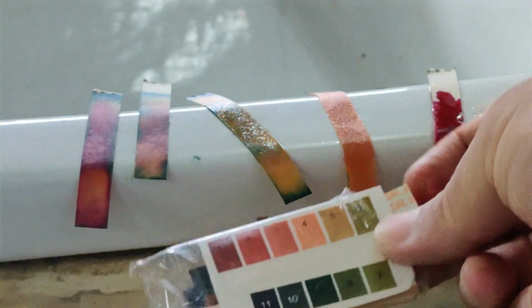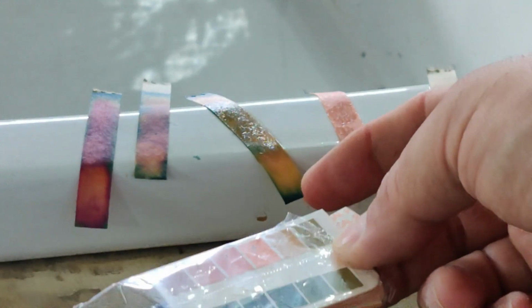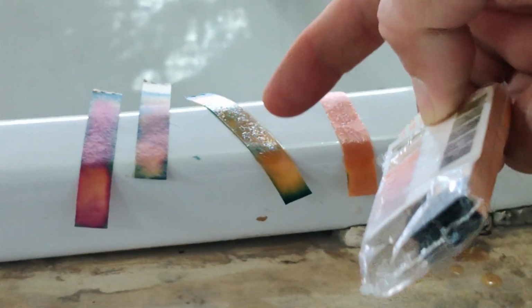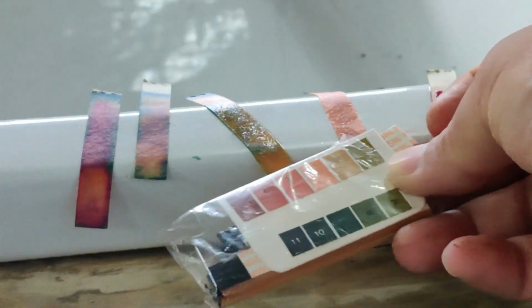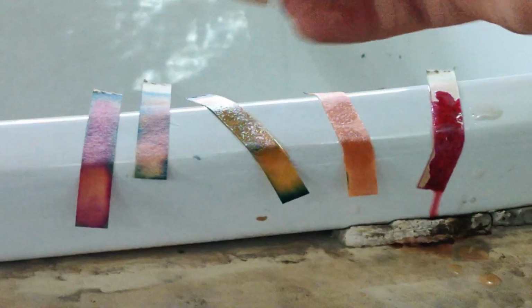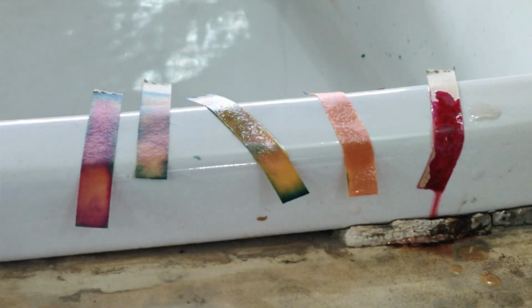This one was matching a somewhat greenish color, if you can look at this one, greenish and somewhat, if you look at that side. I think I had added acid somewhere here. So I think we should compare that color. I think it is showing something like this, 5, that is also acidic. And if you go to that, that was more towards the bluish side, greenish side. You can see, you can match like this. So those were 2 bases. So these were bases, and this is how we use the indicator, the universal indicator, to detect the pH value of different solutions. So that was about the chapter acid, base and salt.